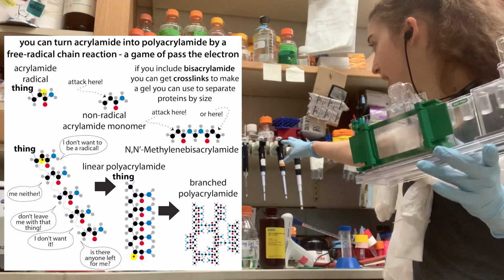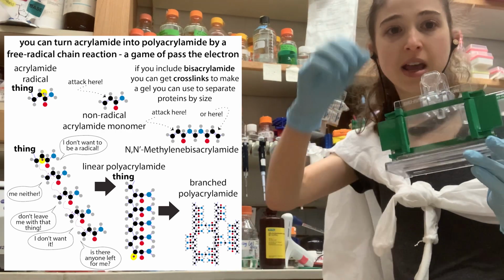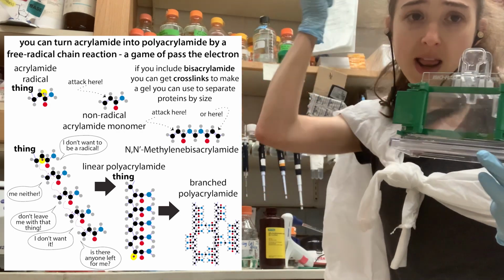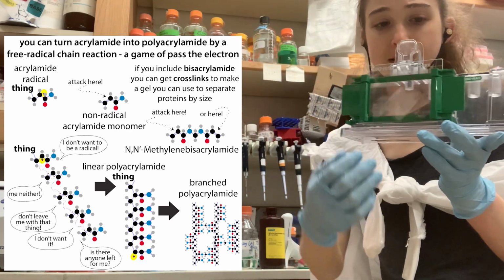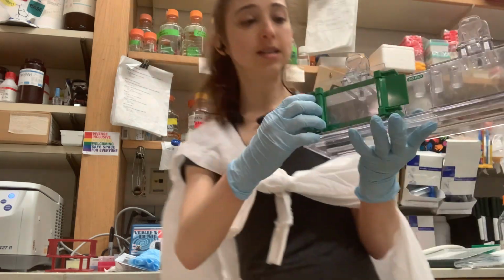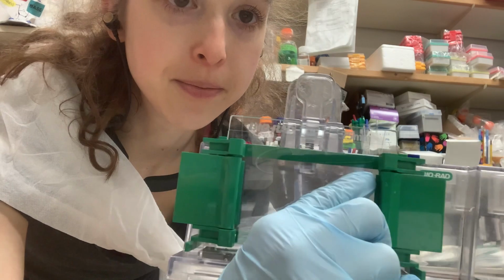And so you want to make sure that you have everything set up. Like, I put my pipette tips, get them ready so I can add the APS. Then slowly invert it, you don't want to get bubbles. Then go add the TEMED, slowly invert it so you don't get bubbles, and then bam, it's in here. And so what I do with an SDS page gel is I fill it to about this line.